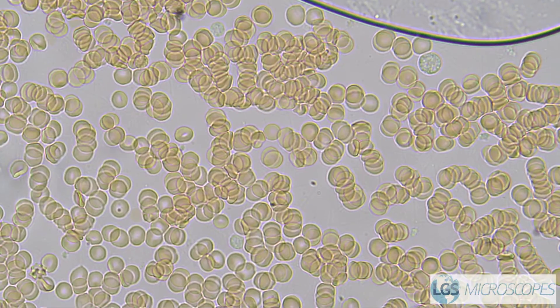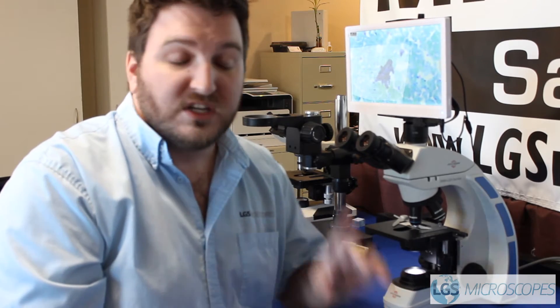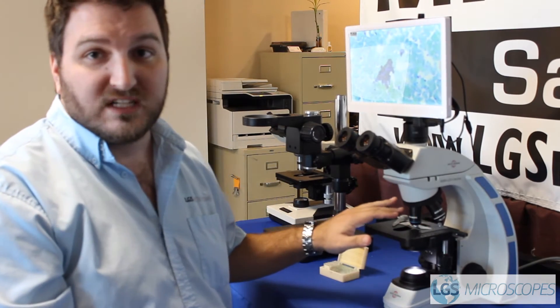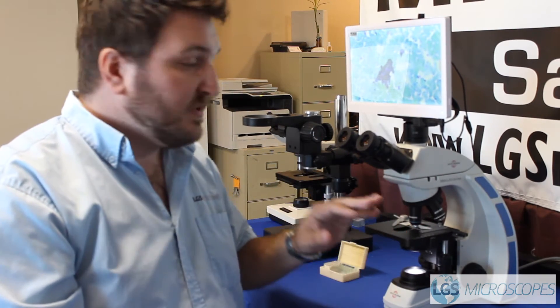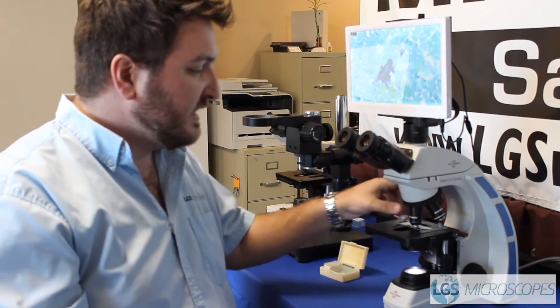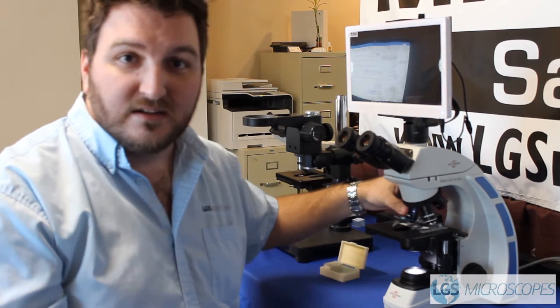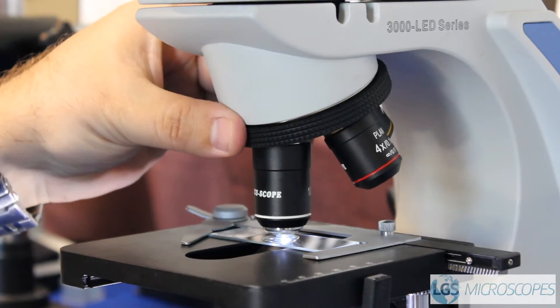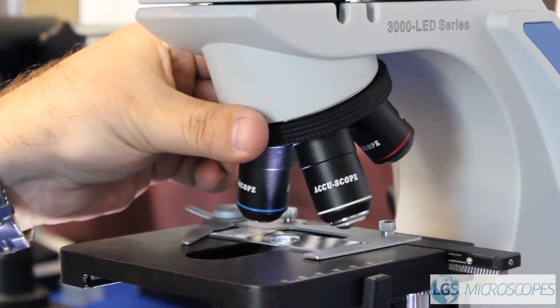Then it's time to move on to the 100x objective. Here at LGS we don't just do sales and training — we also do a lot of service. The number one reason we get calls for any biological microscope needing service is because there's oil on the 40x objective. The reason that happens is someone uses oil on the 100x objective, swings back to the 40, and now you've gotten oil all over your 40x objective. This is what kills most microscopes and costs a lot of money to repair.